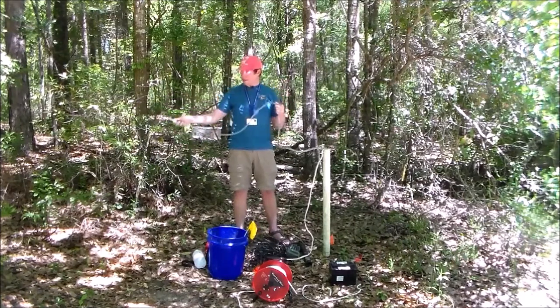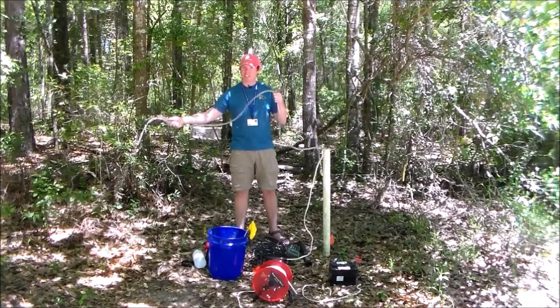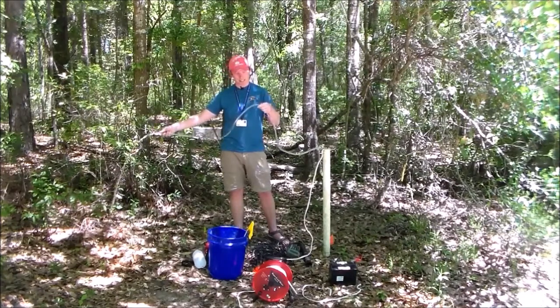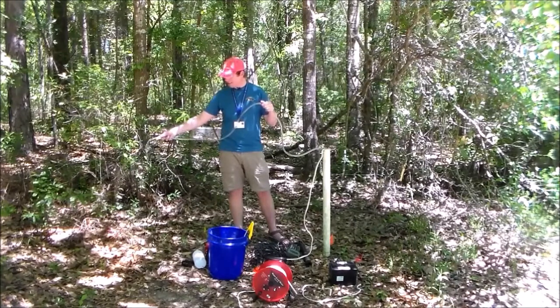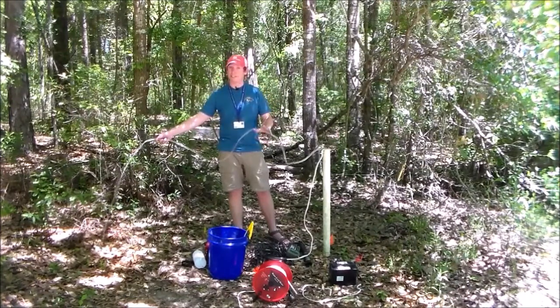One thing before I cut the video and cut ahead is that it's kind of cool. I can feel this water is cool. Feels nice and cool, maybe in the 50s or 60s. I'm getting a little bit of condensation on the hose here, so it's kind of nice. It's hot outside, but the groundwater is nice and cool because it's insulated.